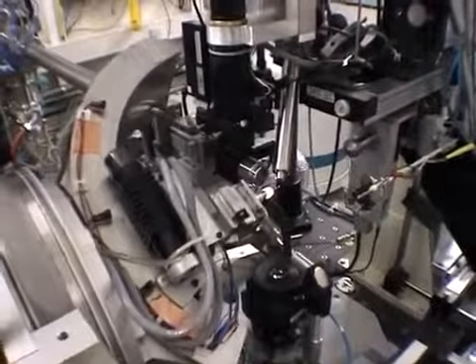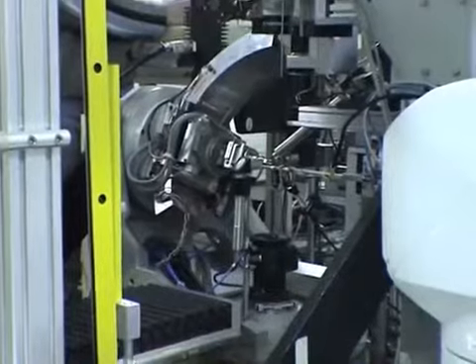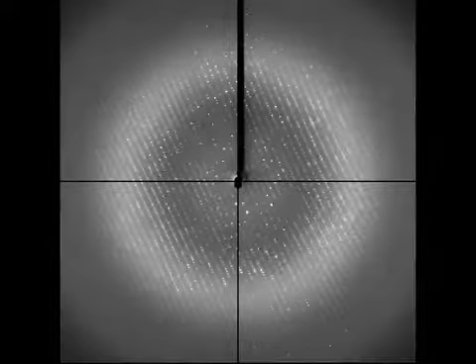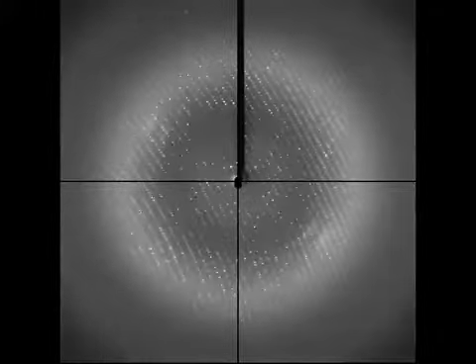The experiment itself consists of capturing several hundred images while the crystal is turned in the X-ray beam in order to analyse it from different angles. Here is a series of pictures that have been recorded during the analysis of a crystal of protein making a 180-degree rotation. Each spot on the screen corresponds to a beam of diffracted X-rays. The intensities of the spots that make up these strange constellations are measured by a computer that looks at the whole series of pictures.